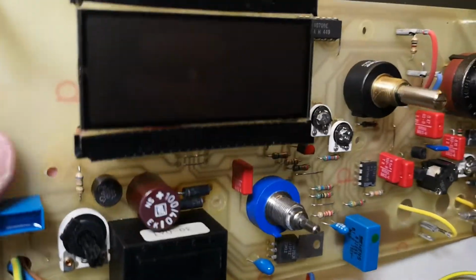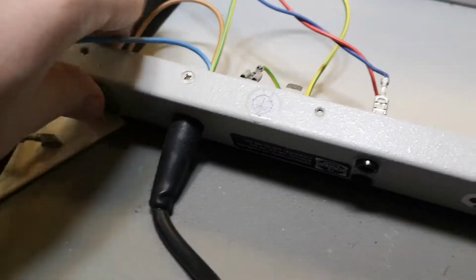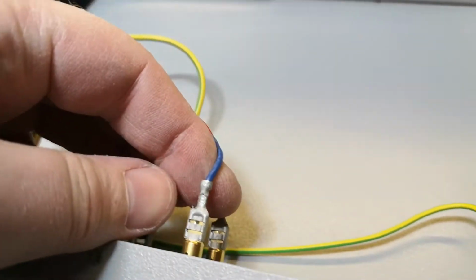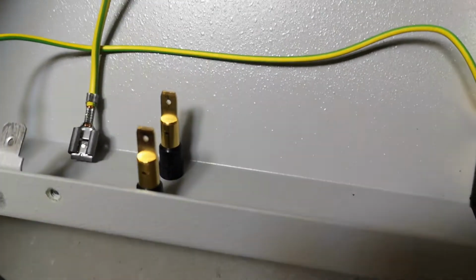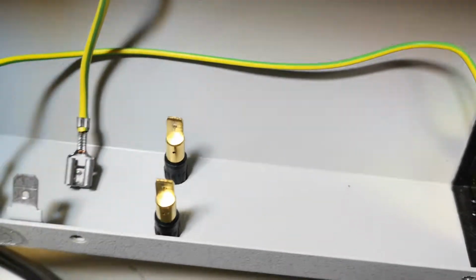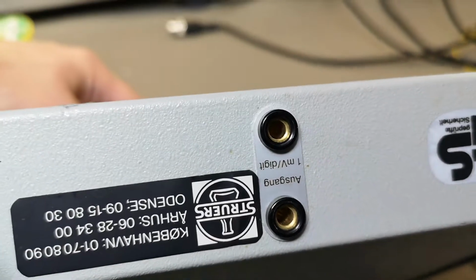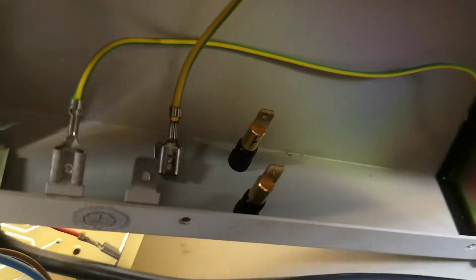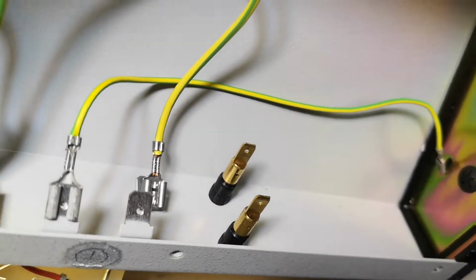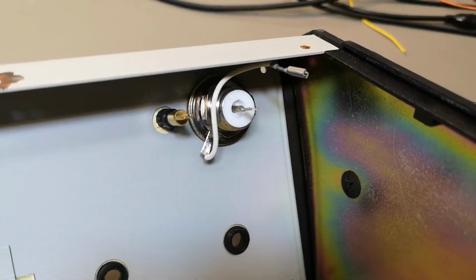So that was it. A super fast teardown of this fantastic instrument. Those are really cute. Oh, look at that. Made in one piece. Of course, because its output is millivolts. So you want really good banana plugs. Gold plated and all the super dupers. Just like we like it. And there's one more here. Even look at that connector. It is really nice. I like it.